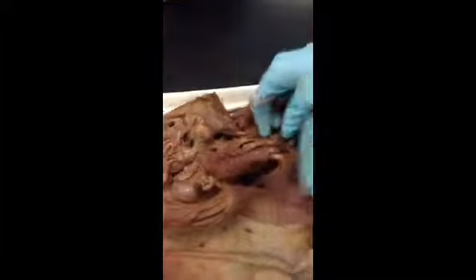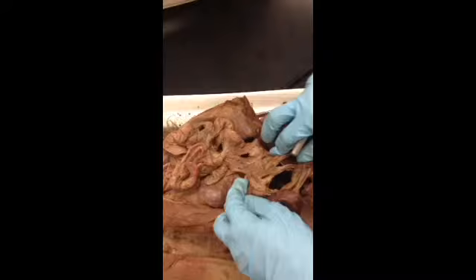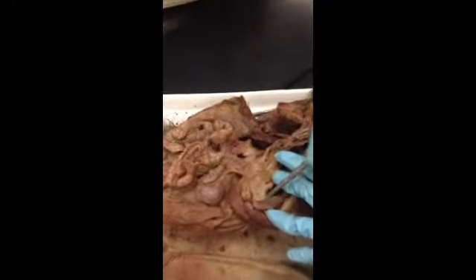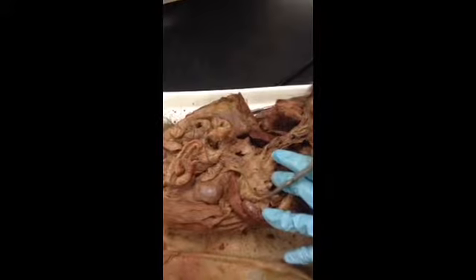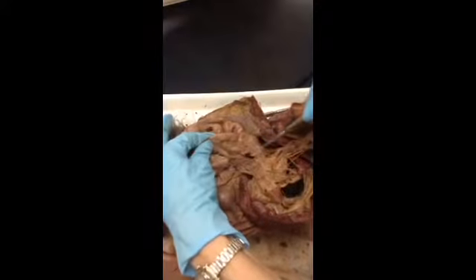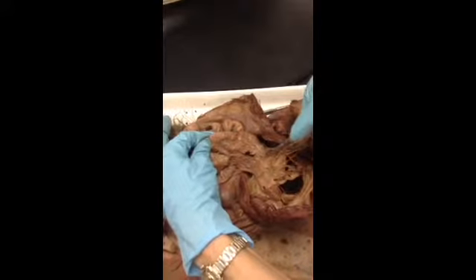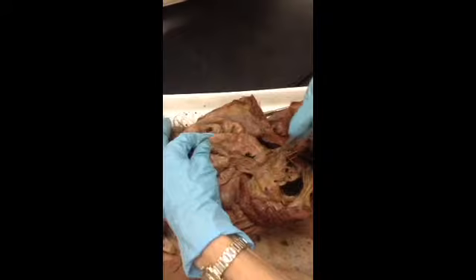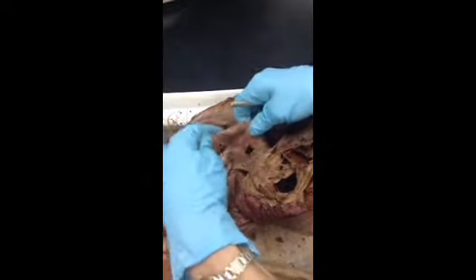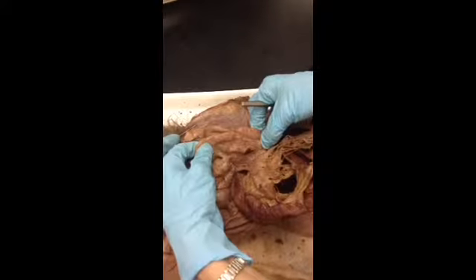Pull this gunk out of the way. Here's the big spleen over here, the beef teriyaki. And then we need to find the pancreas. So here's the pancreas here. It goes from the spleen, it gets lost in here in the fat a little bit, and then it comes out here on the duodenum. Okay, so this is all pancreas. Right under there, right over to the duodenum. Okay, so this first loop here, where you have the pancreas attached, that's the duodenum.